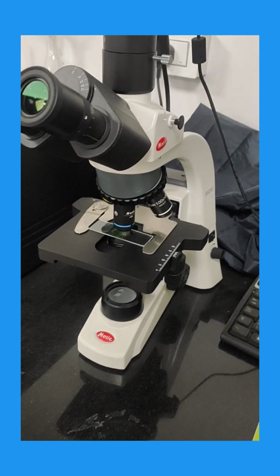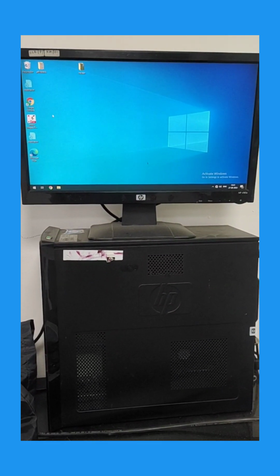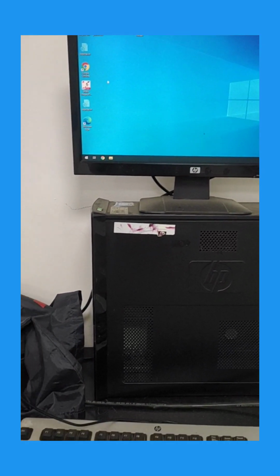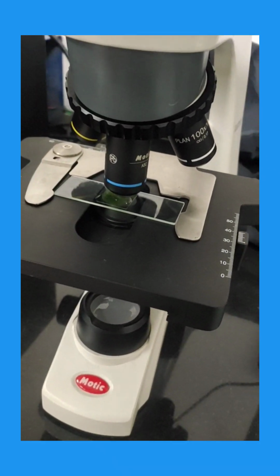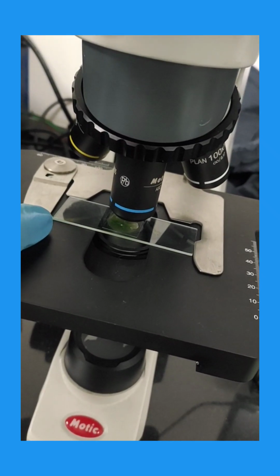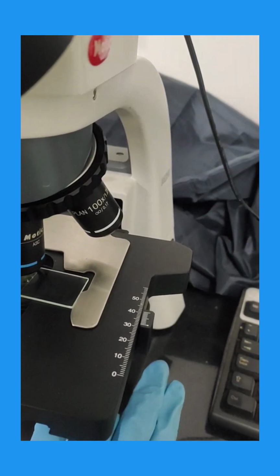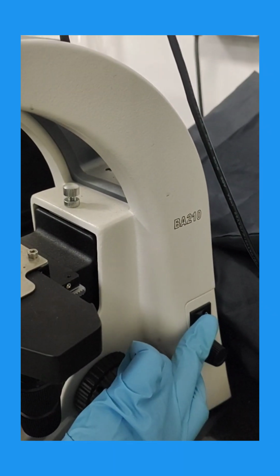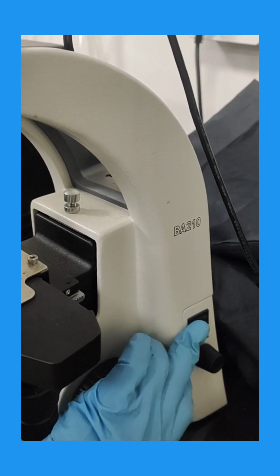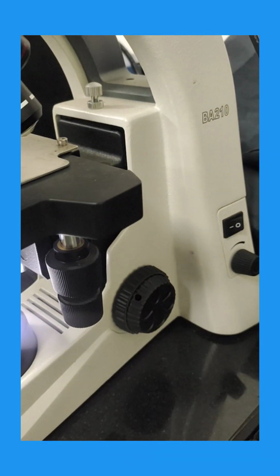First of all, I have placed the slide. There is a computer system attached to this microscope for the camera. So here is the slide placed. Next we have to turn on the switch of the microscope. This switch will turn on the light just below the condenser lens.